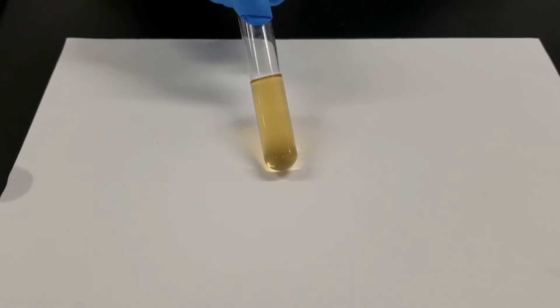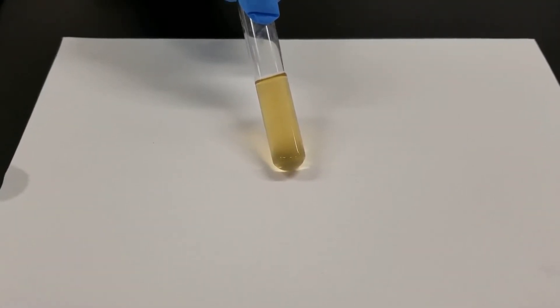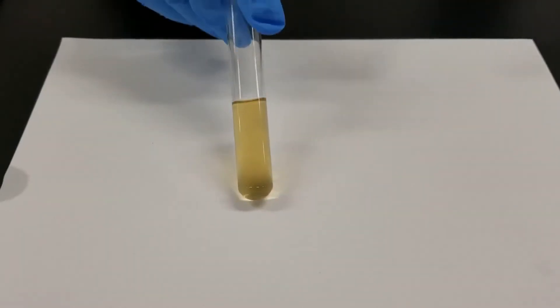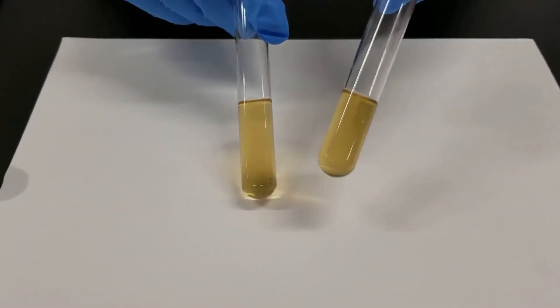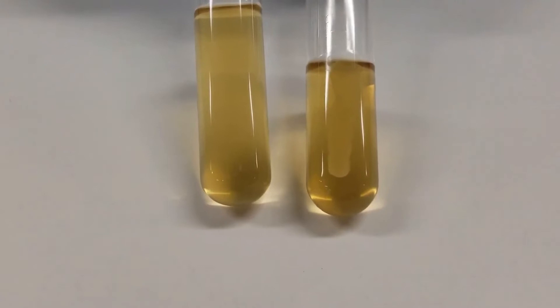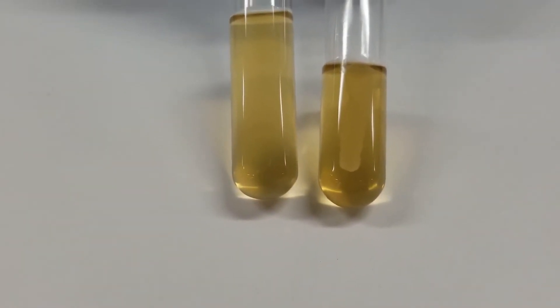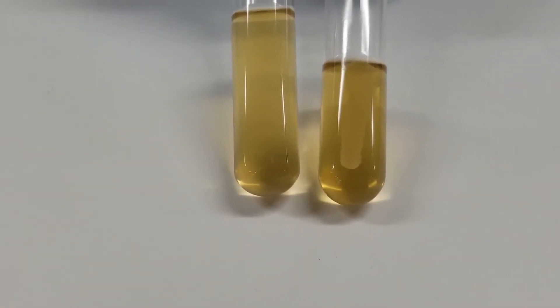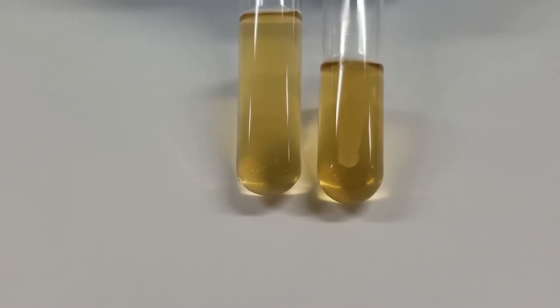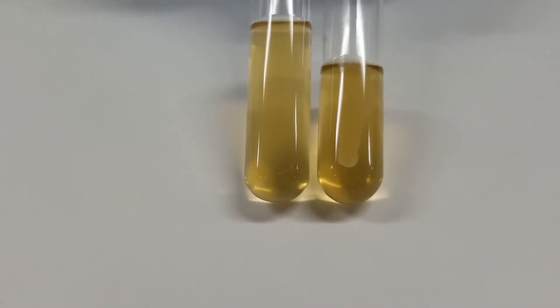This is an un-inoculated tube. I have three different examples to show you. This is the un-inoculated, and this is inoculated. As you can see, I used a loop to inoculate. The growth is just along where the loop went, but you can definitely see growth in there.